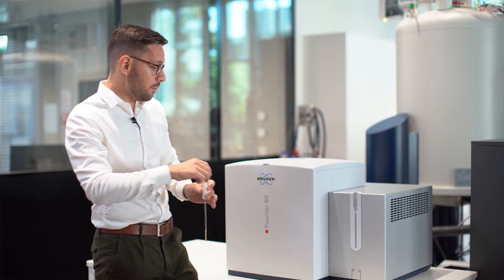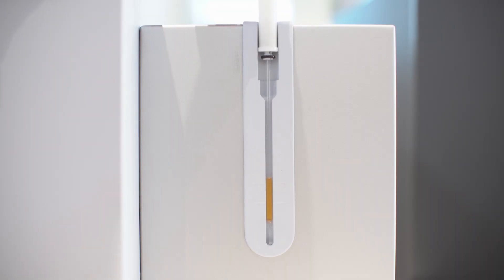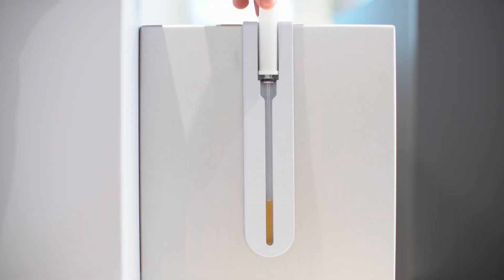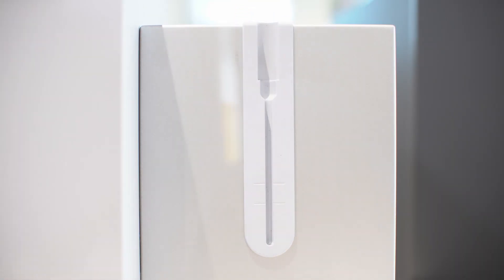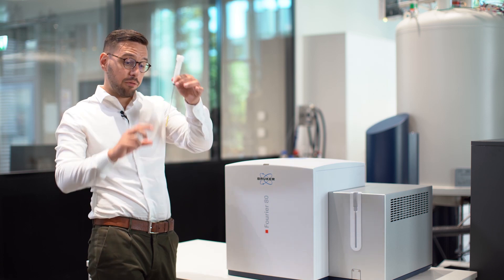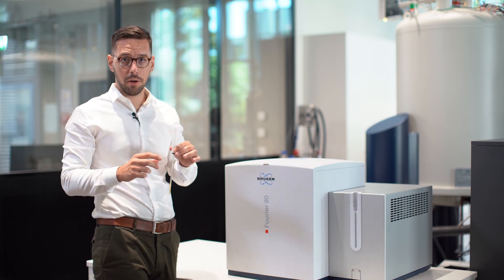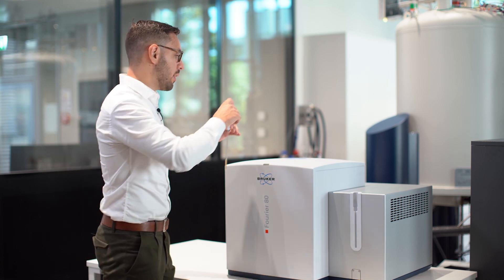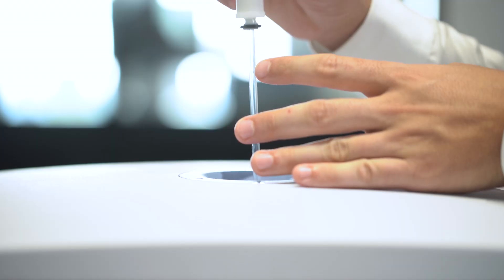Then you can use the gauge on the right side of the instrument to adjust the sample height. That's the perfect height for the sample to be centered in the NMR coil, and then you can insert the sample in your spectrometer.